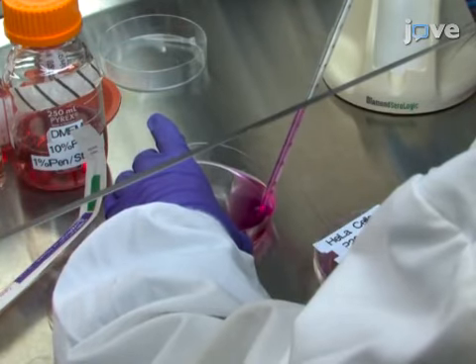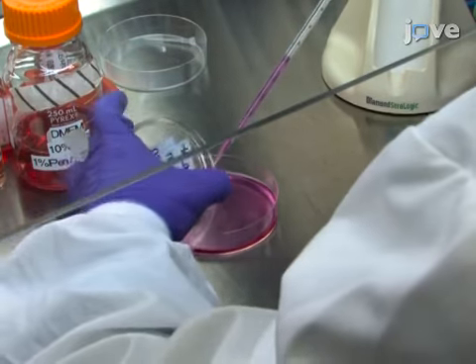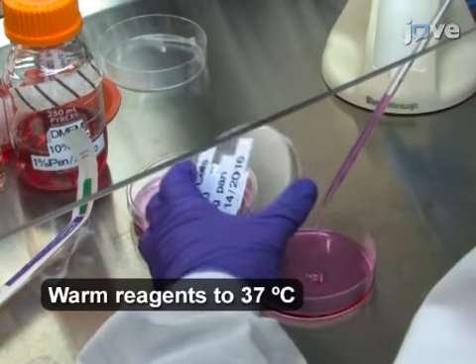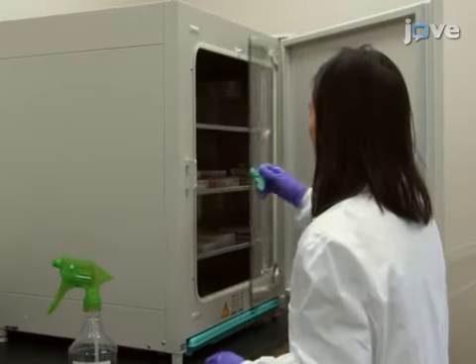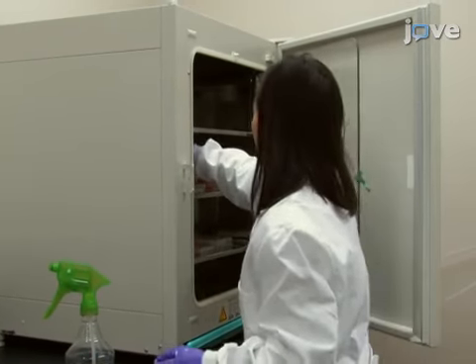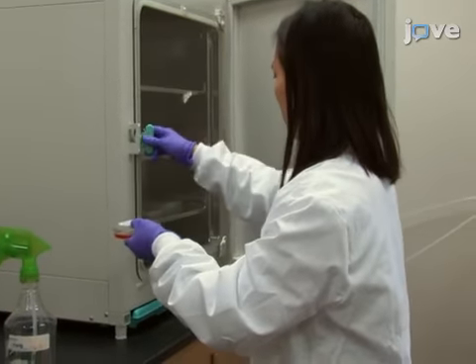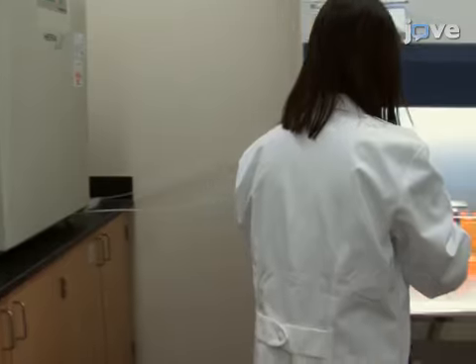Obtain a cell sample, such as 1 milliliter of HeLa cell suspension, and add it into 9 milliliters of complete cell culture medium in a standard 10 centimeter cell culture plate. Keep the cells in culture at 37 degrees Celsius with 5% CO2 for 2 to 3 days until the growing surface is covered at 70 to 80% on the cell culture plate.